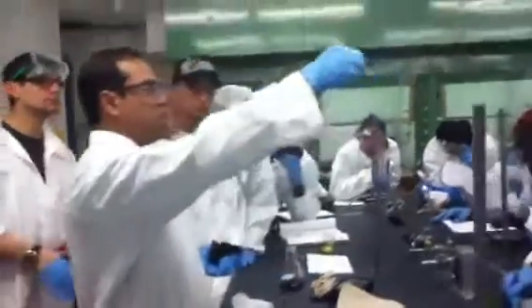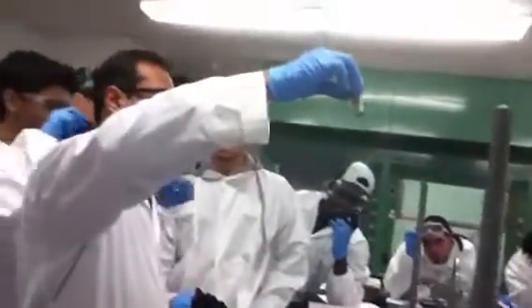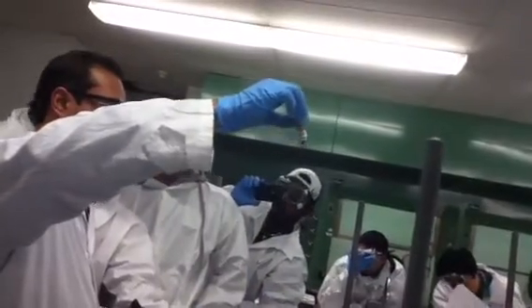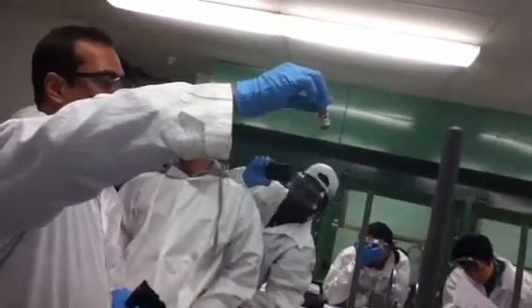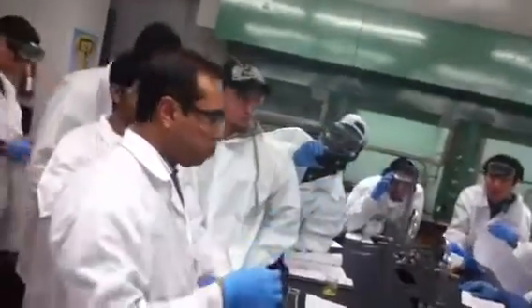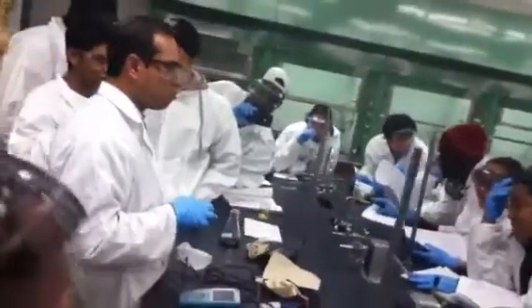This is a tiny bottle, which is very air sensitive in this case, right? And which is very expensive. About how much would that be? I think it's only $300 or $400. Really, for that? What is that? Yeah, it's true. Oh my God.